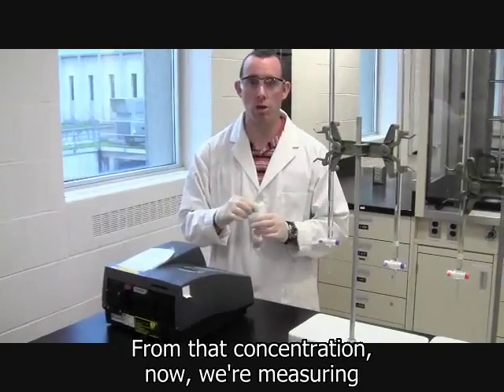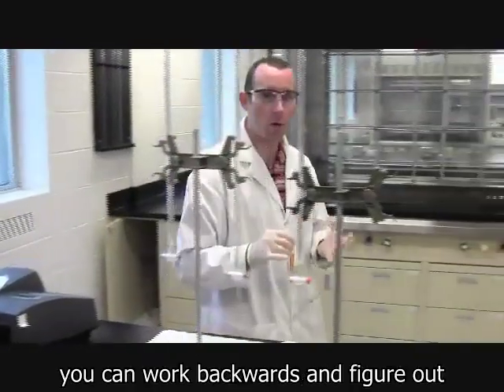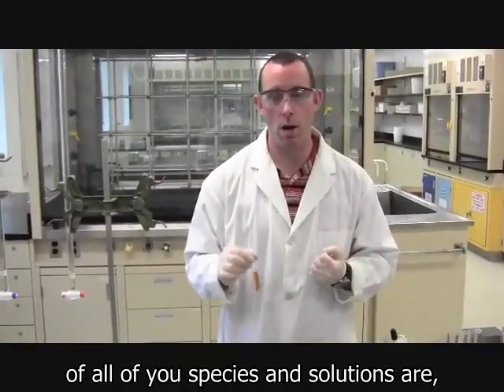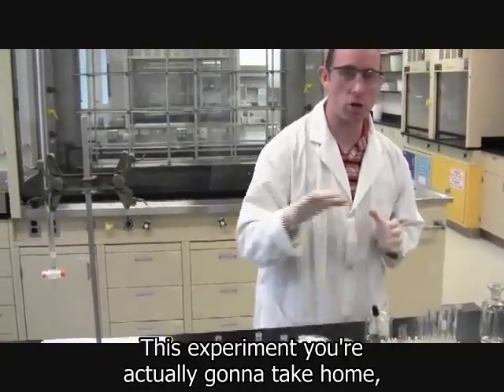From that concentration, we're measuring the in situ concentration of the iron thiocyanate. You can work backwards and figure out what the equilibrium concentrations of all of your species in solution are and calculate what the equilibrium constant is. This experiment you're actually going to take home.